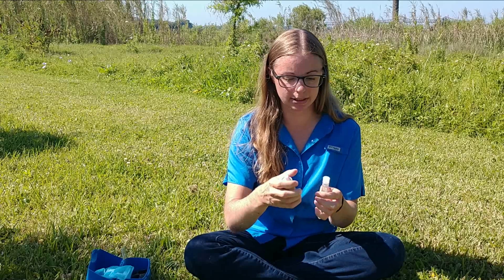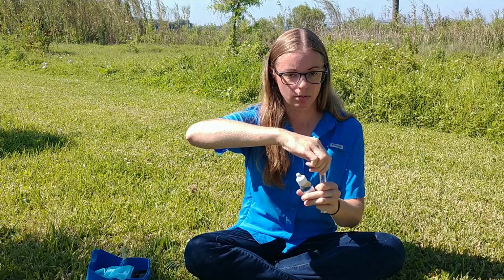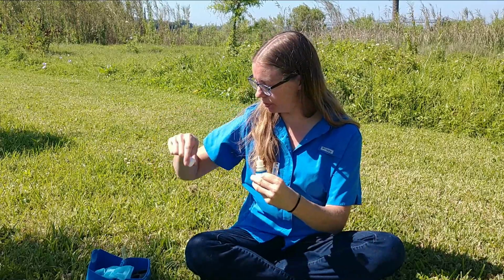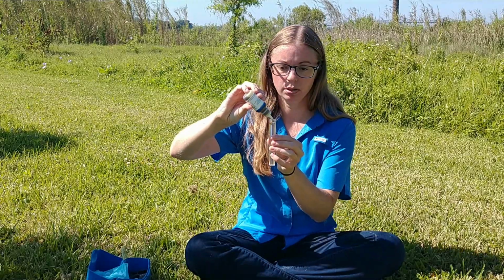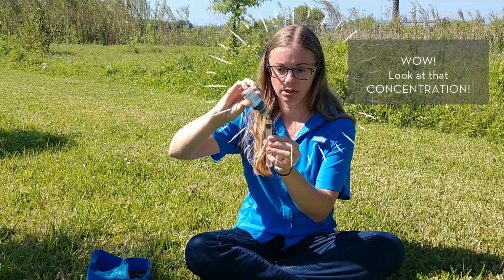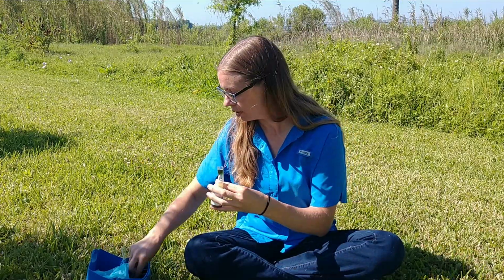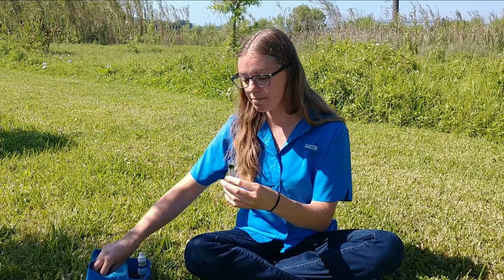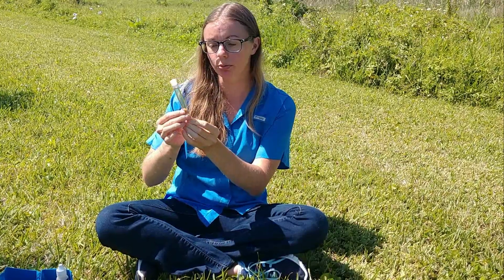So let's go ahead and test our pH levels. So I'm just going to add 10 drops of this reagent into my jar. All right, put the cap back on both of these items, and then I'm going to mix for 30 seconds to a minute. We've inverted our solution for about a minute, and the color is a greenish color.